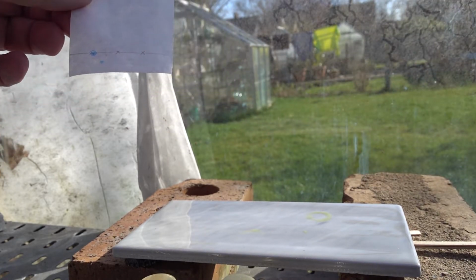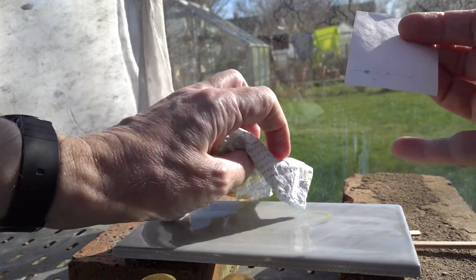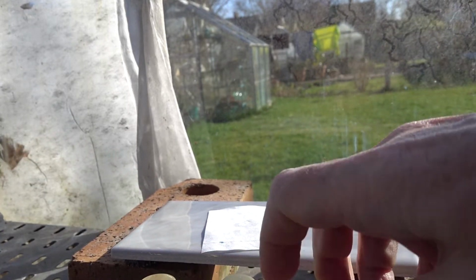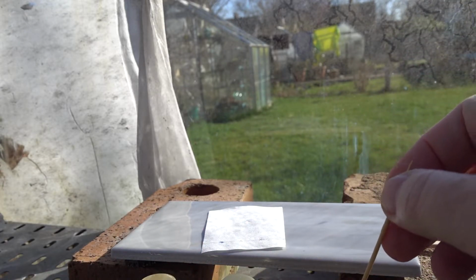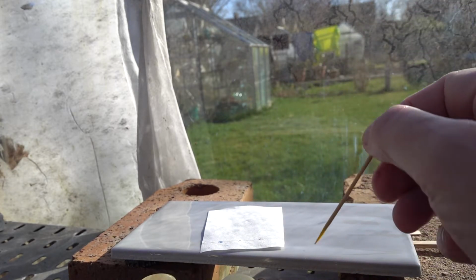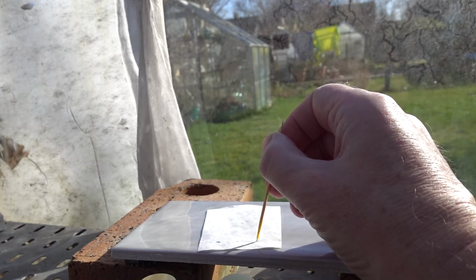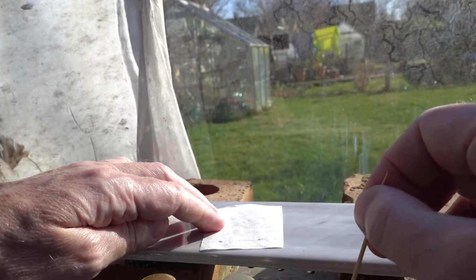On the tile here, we will just have to wipe the tile there. We've got some of the yellow colour spilt on. Now we can have a look at spotting. Well, first the yellow, and we can spot using a cocktail stick to get enough sample on. So a tiny little touch on the paper, don't let it run down. Might have to repeat that a couple of times so that you get a nice tight little spot of the yellow material. And this of course contains the curcumin.